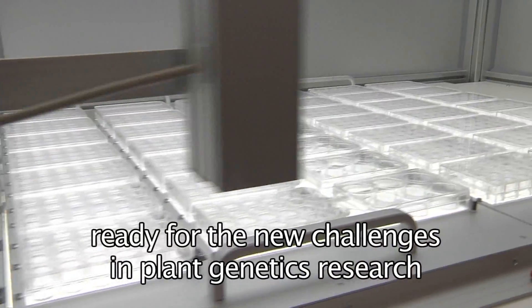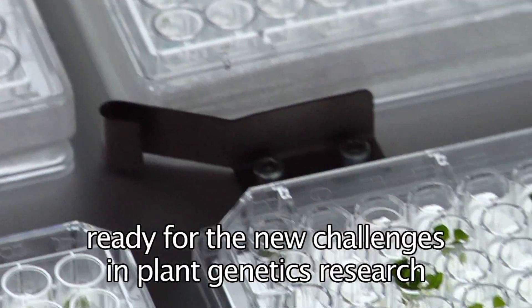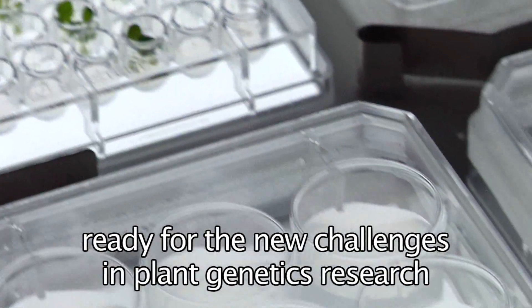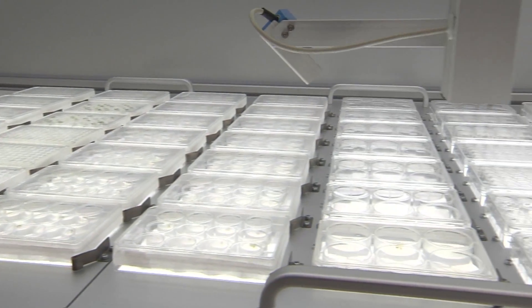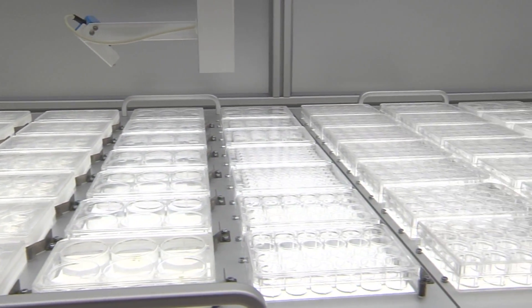The Lemnatec Scanalyzer HTS is equally able to scan adult Arabidopsis rosettes on trays and very small seedlings, insects or other organisms in 96-well microtiter plates.